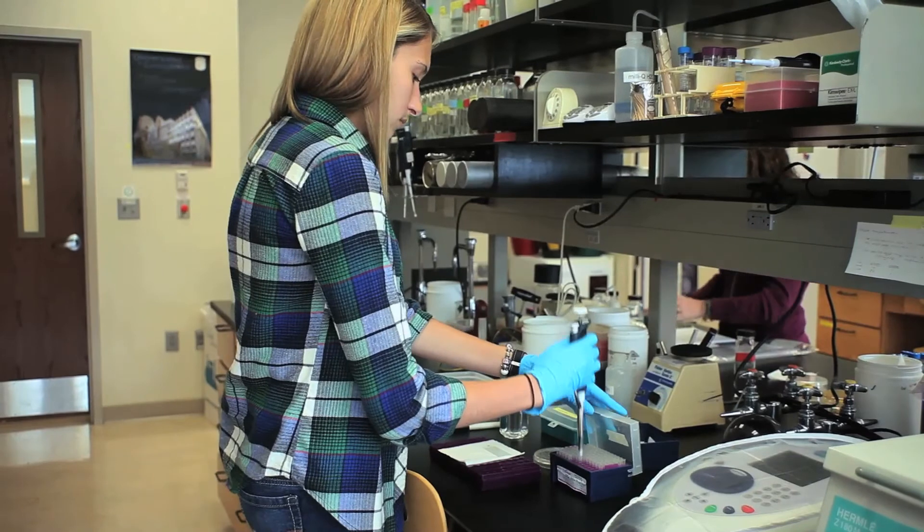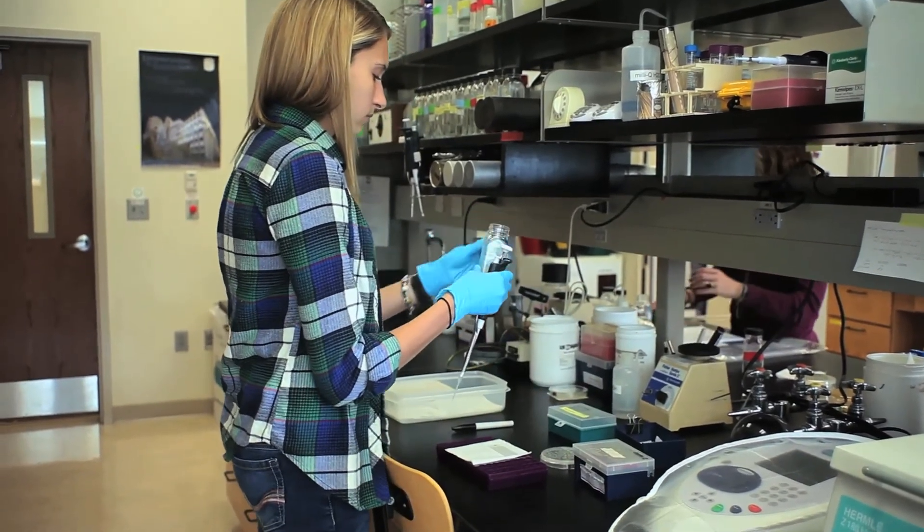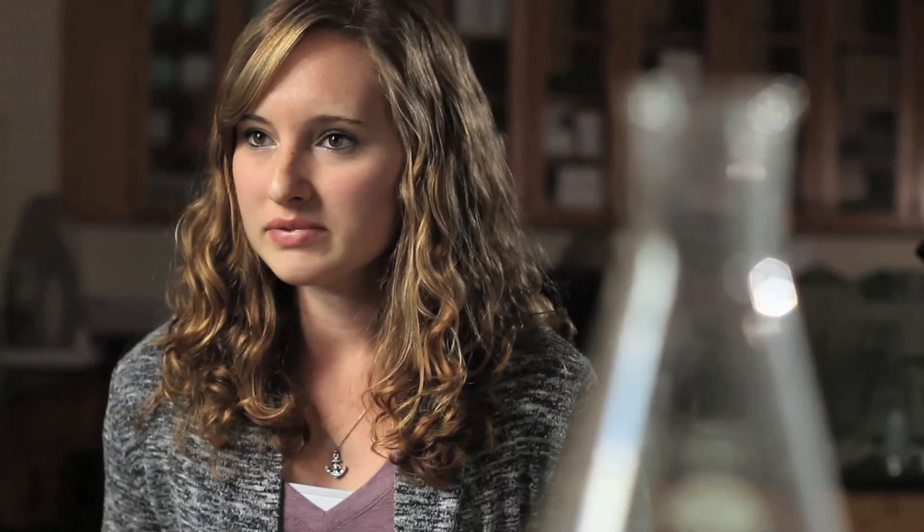I'm basically looking at orphan genes within the genome, and I'm working with Dr. Keeney to create a pipeline process of how to get these genes classified. We delete the gene and we put the gene into a vector, and then we can put that vector into the yeast cells, and we can look at the phenotypes that the yeast cells show after you put that deleted gene into them, and determine if they're essential or not — whether the cells die afterwards.